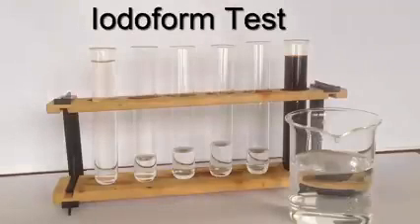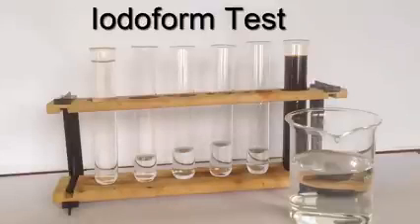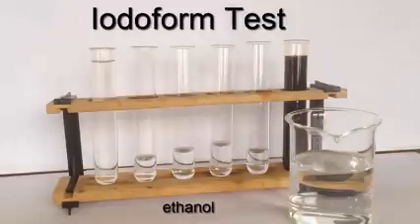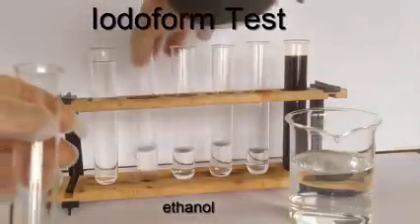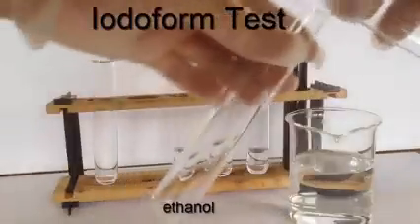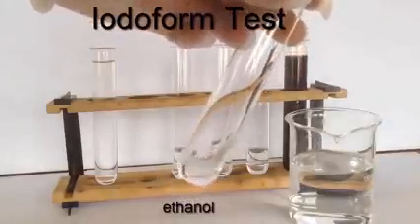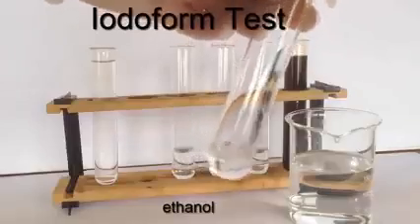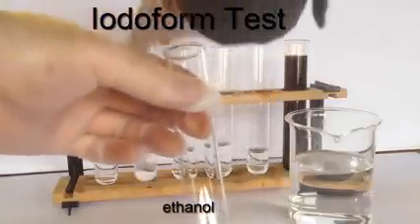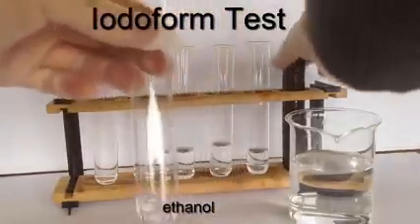This happens if we have an alcohol with that particular type of grouping, that's to say where we have a carbon that's attached to an OH and is additionally attached to both a methyl group and a hydrogen atom. So let's get the tests underway so that you can see what happens and where the test is positive and negative. I'm going to begin with the ethanol, as you can see, and I'll take some in a second boiling tube. Normally we just take 1 or 2 cubic centimeters of the alcohol in a test tube, but for the purpose of this demonstration video I've taken a much larger volume.